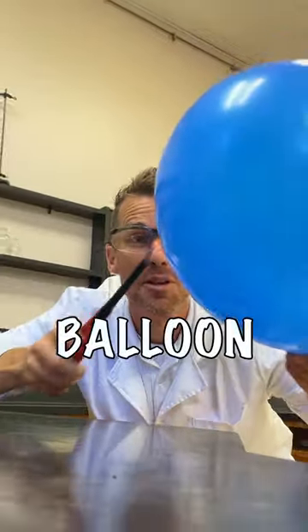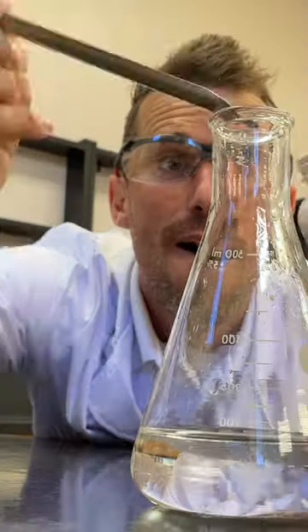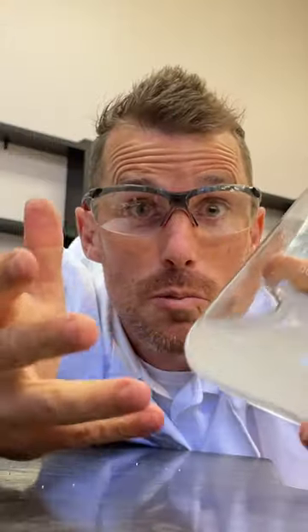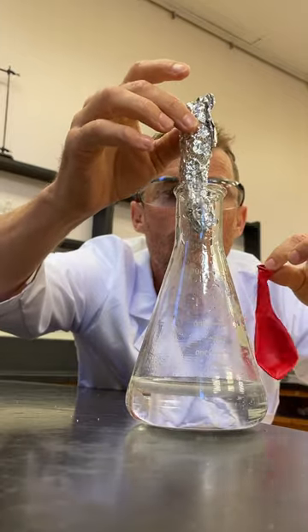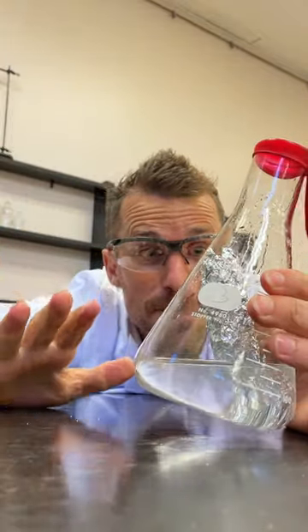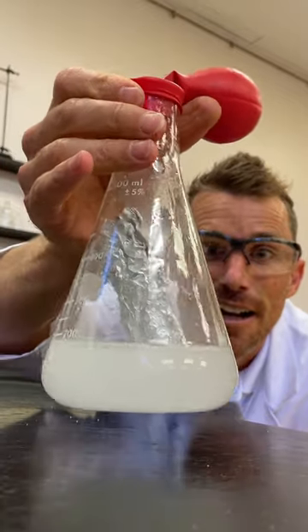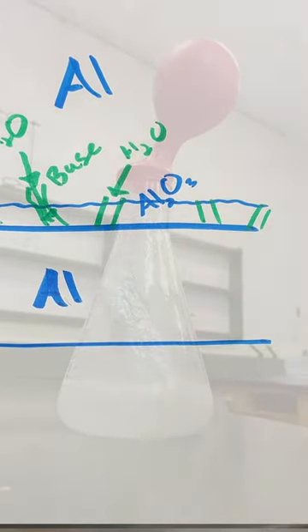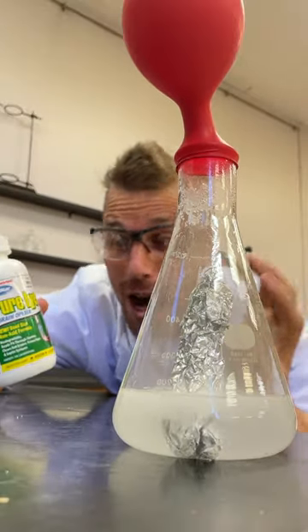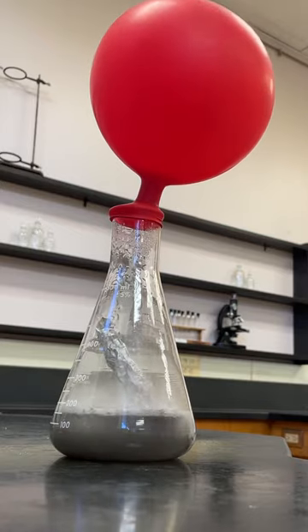What's the difference in lighting a balloon filled with air versus a balloon filled with hydrogen? If we put some water in a flask and add some sodium hydroxide, the solution gets really warm as the sodium hydroxide gets surrounded by the water and makes these cool hydration shells. Now if we add aluminum and then cover it with a balloon, the aluminum has a thin layer of aluminum oxide on the outer crust, and the sodium hydroxide base punches holes in that so the water in the solution can react with the aluminum and release bubbles. Our balloon is getting filled with hydrogen from the initial water and sodium hydroxide. The reaction itself is actually really exothermic, so it starts to get really, really hot the longer it progresses.